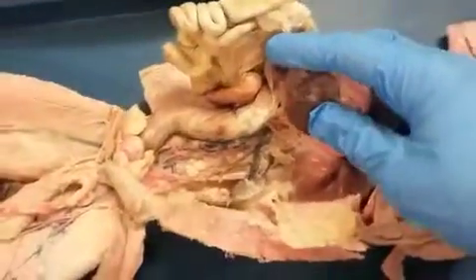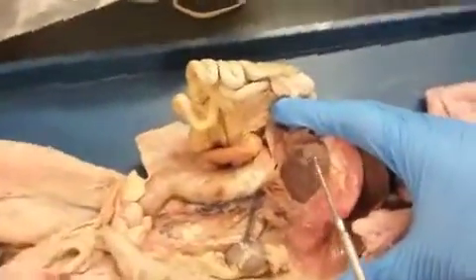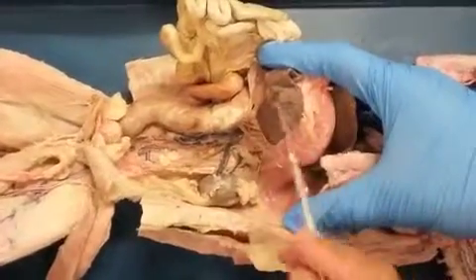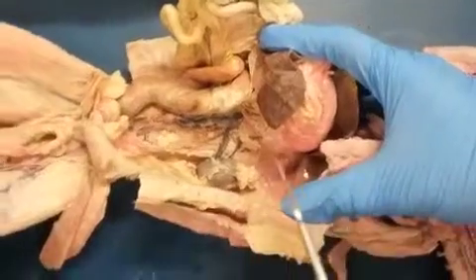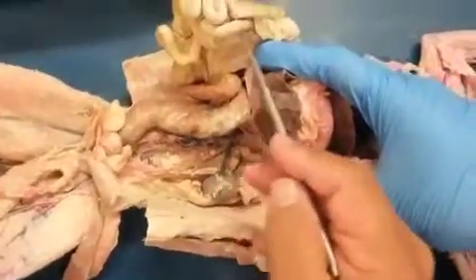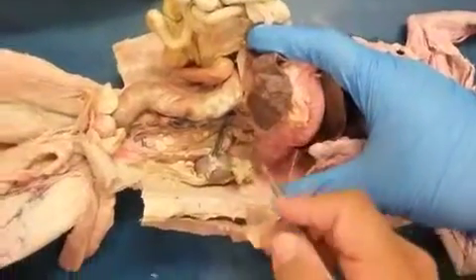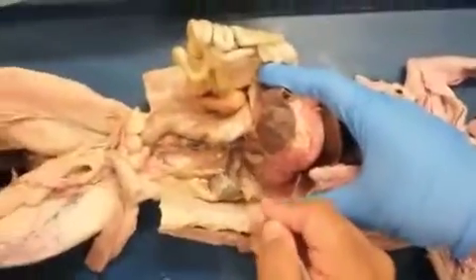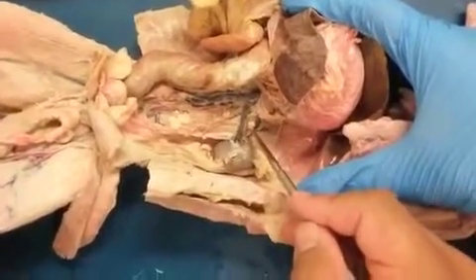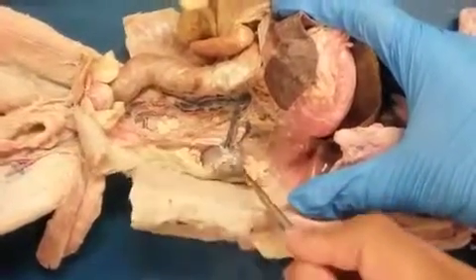So again, they're adjacent to each other, forming kind of a V-shaped structure. Right? Celiac trunk first, superior mesenteric second. The celiac trunk is going to supply the splenic, the left gastric, and the hepatic arteries, which then supply these three organs. Right? The superior mesenteric again is going to supply the mesenteric arteries within the small intestine, supplying the small intestine. As you continue to make your way down, the next branch off of the abdominal aorta is going to be the renal artery, which you see right there, supplying the kidney.